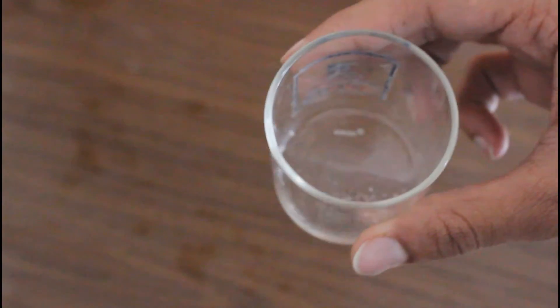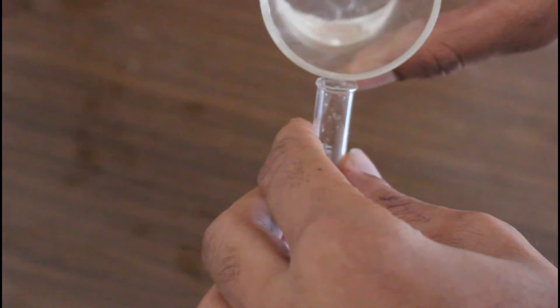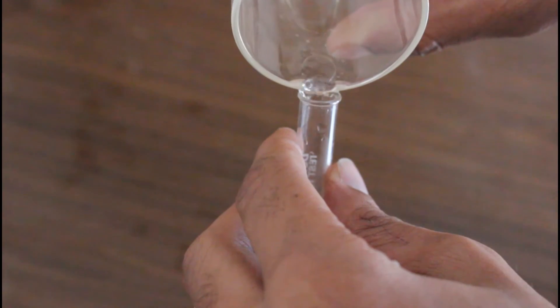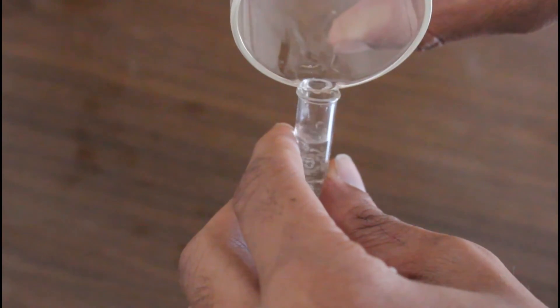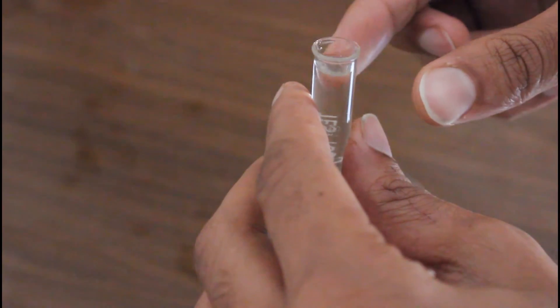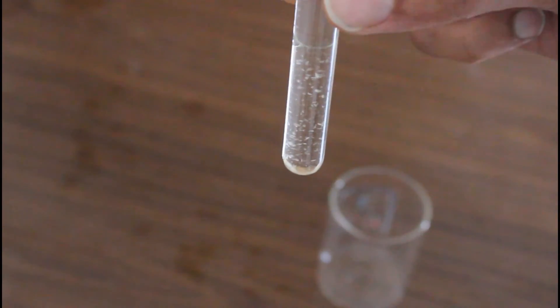Okay, here you can see a few ml of liquid we have collected and now we can test the sample. As you can see it has some oily substance inside. Here you can see it forms two layers and the upper layer is oily and the lower layer is like water.